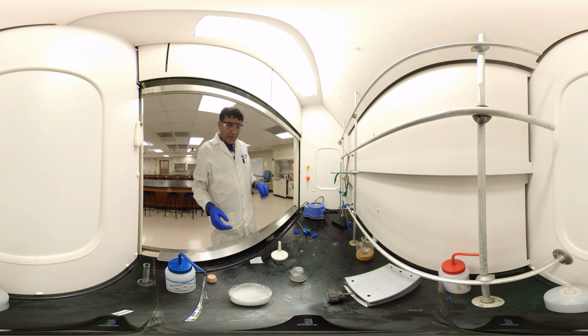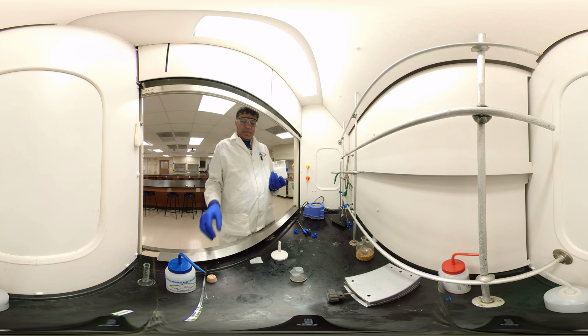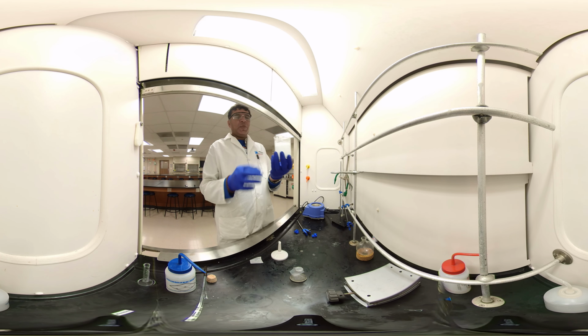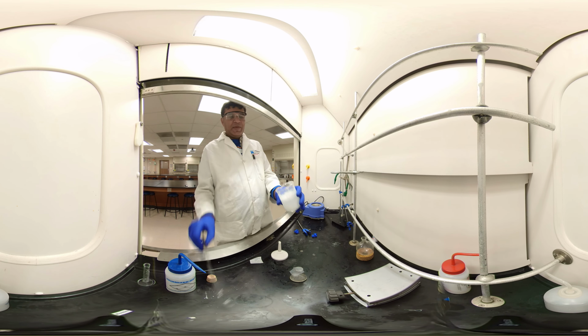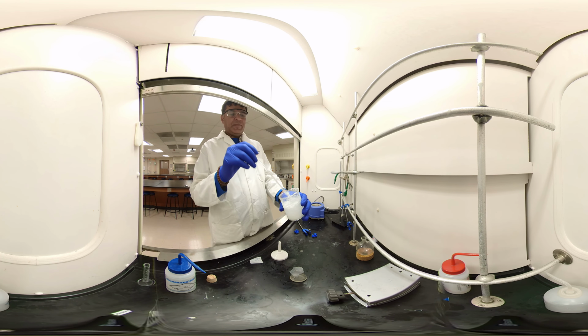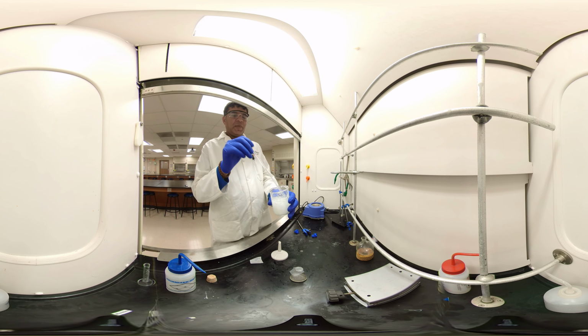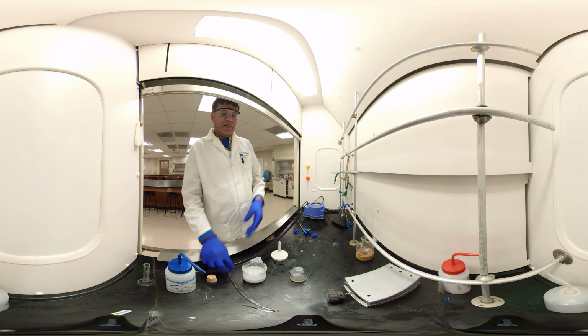Okay. Let's continue. So I was boiling the benzoic acid. I boiled it. It was a clear solution. I put it in an ice cold bath, and now you see the nice needle shape crystals. Now we need to filter it, dry it, and collect the melting point. When you filter, make sure you wash with ice cold water. I'll show you in a minute.